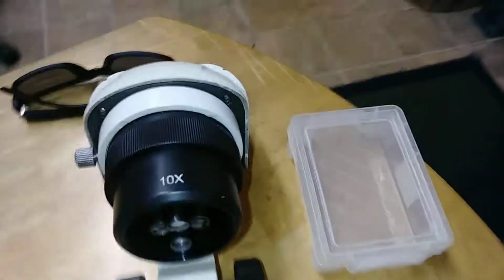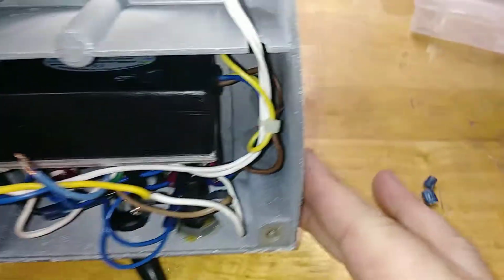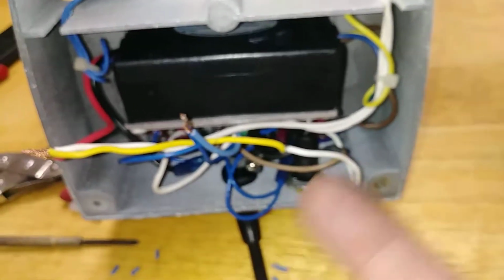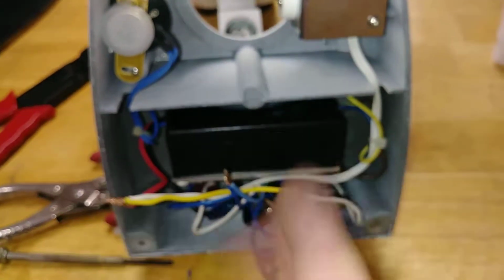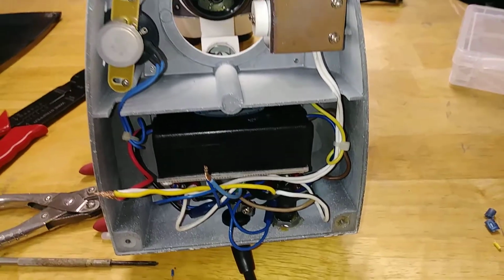There's some fault with the Gemological Institute's actual scope. For GIA to create some kind of subsystem that is obviously manufactured by some other company and not them, to have these kinds of issues, this is acting like a DC system, and it should not act like a DC system. I know there's step-down voltage for regulation of the voltage for the bulbs and stuff, but this shouldn't be happening like this.